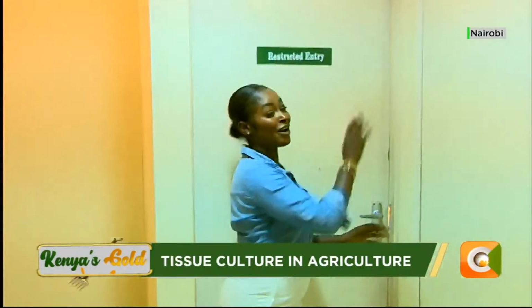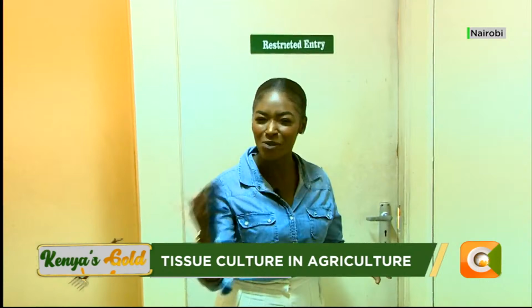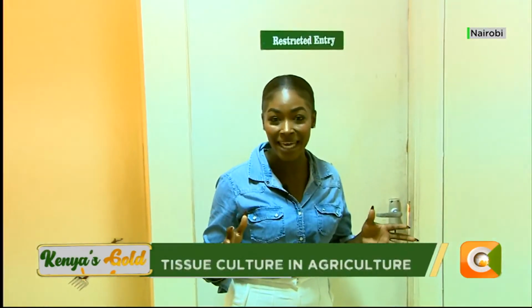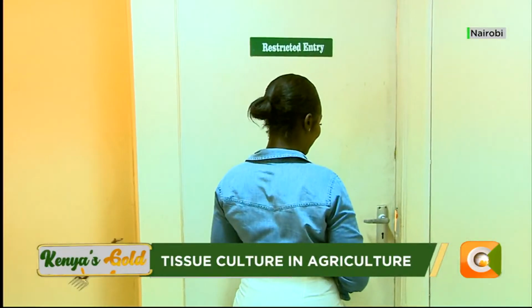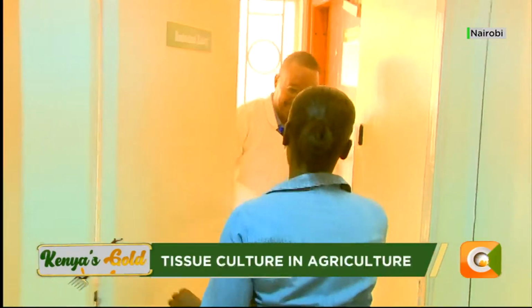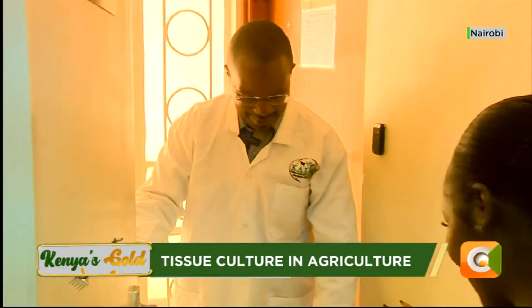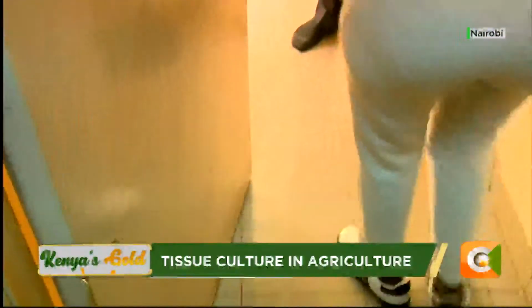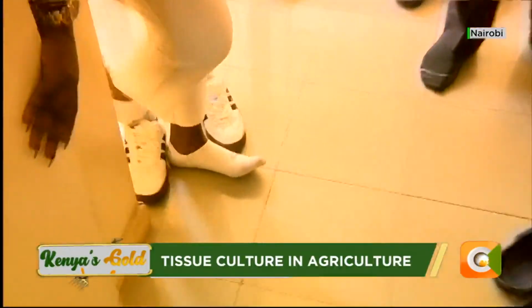So this is a restricted area, as you can see from the door, but of course we have to get you in so that you see what's happening in this lab. Hi, Dr. Martin. Hi, Gina. How are you? Fine, thank you. Good to see you today. Yes, welcome. I can see you in your gear. But you need to remove your shoes. Okay, I can do that here. Yes. All right.